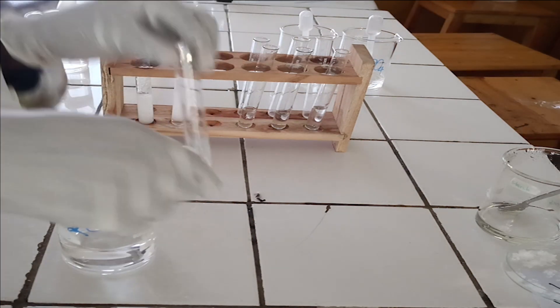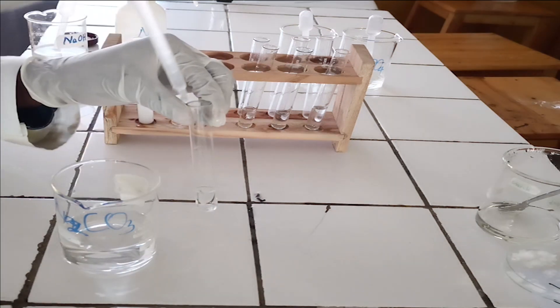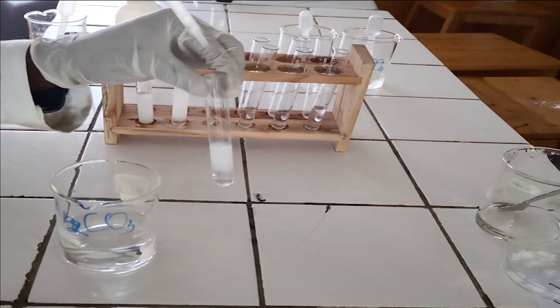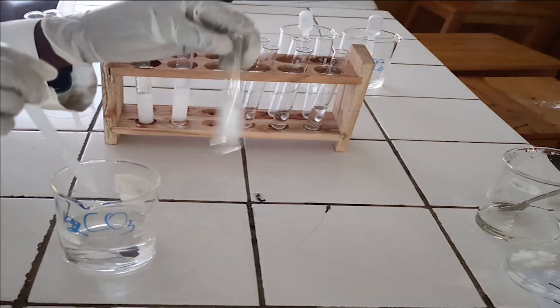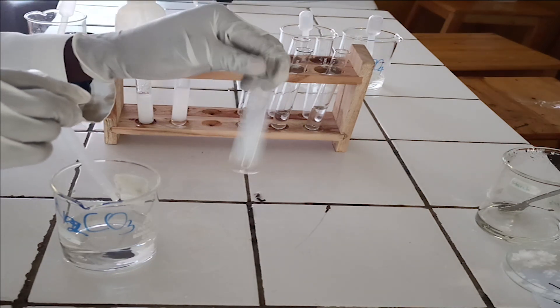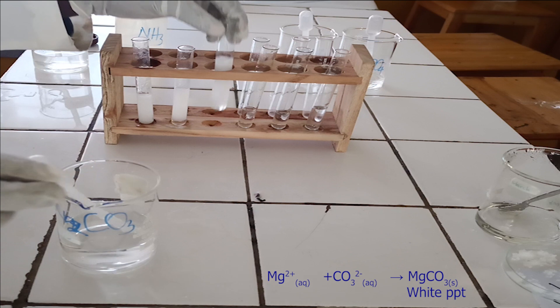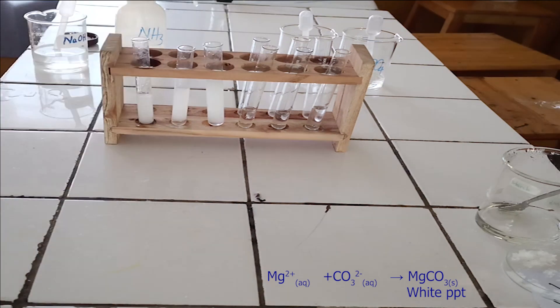To the third test tube, add sodium carbonate solution dropwise until in excess. As you see, sodium carbonate reacts with magnesium ion to form a white precipitate. The precipitate formed is insoluble in excess of sodium carbonate solution. Below, there is the ionic equation for this reaction.